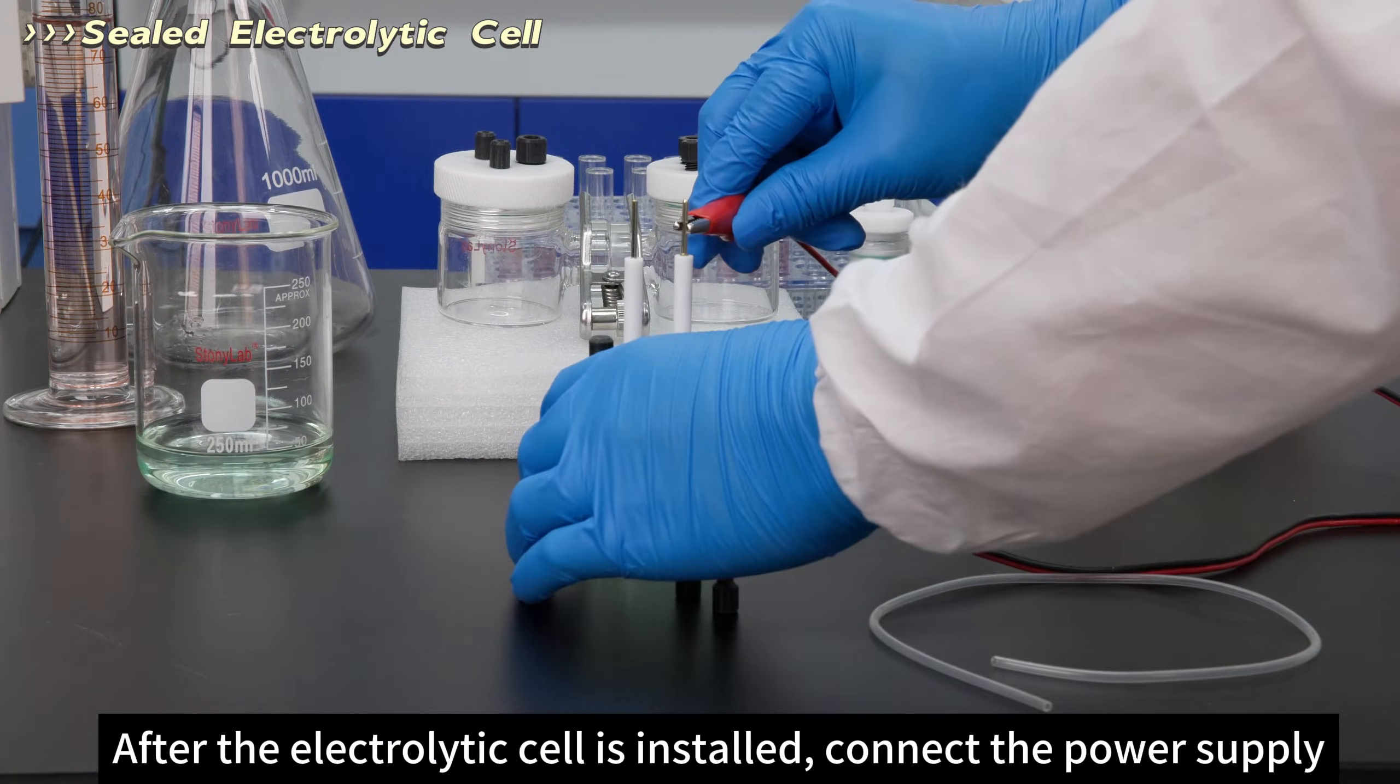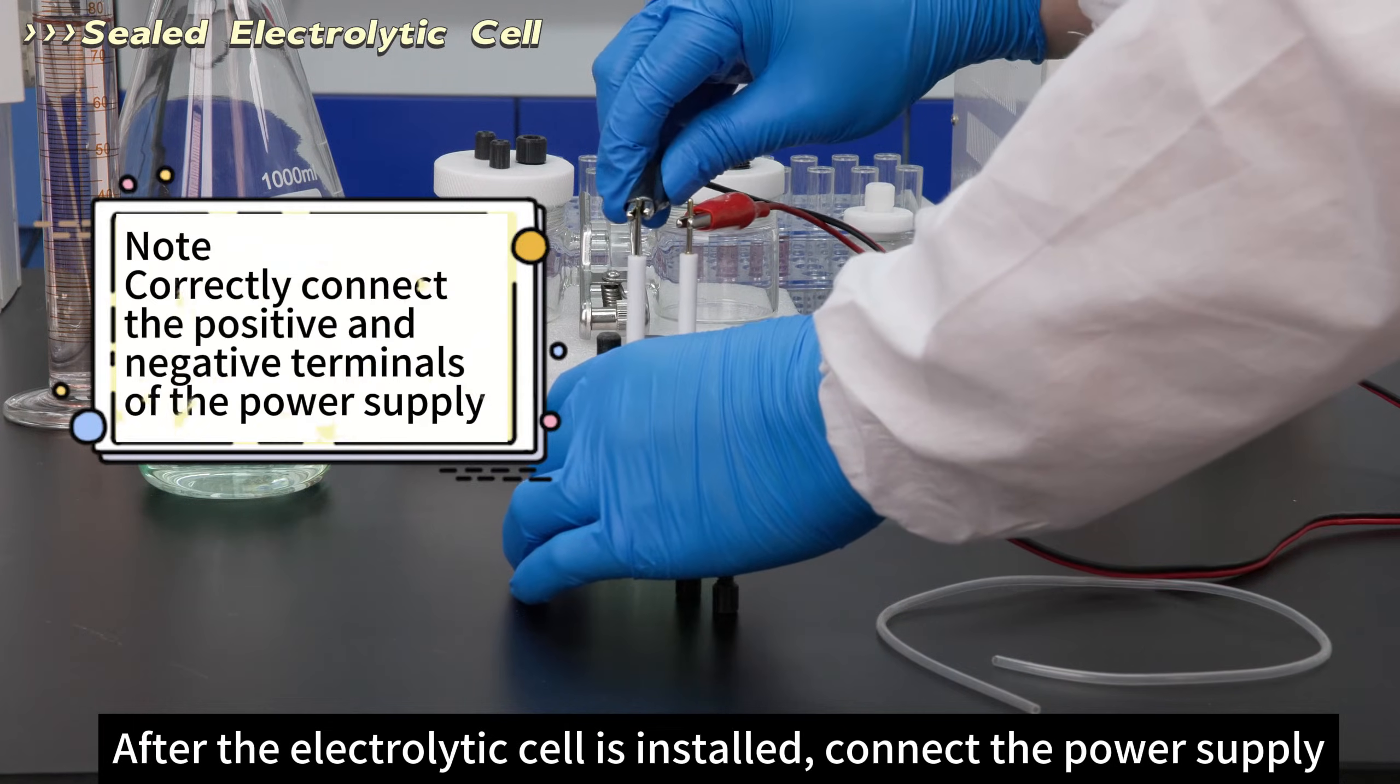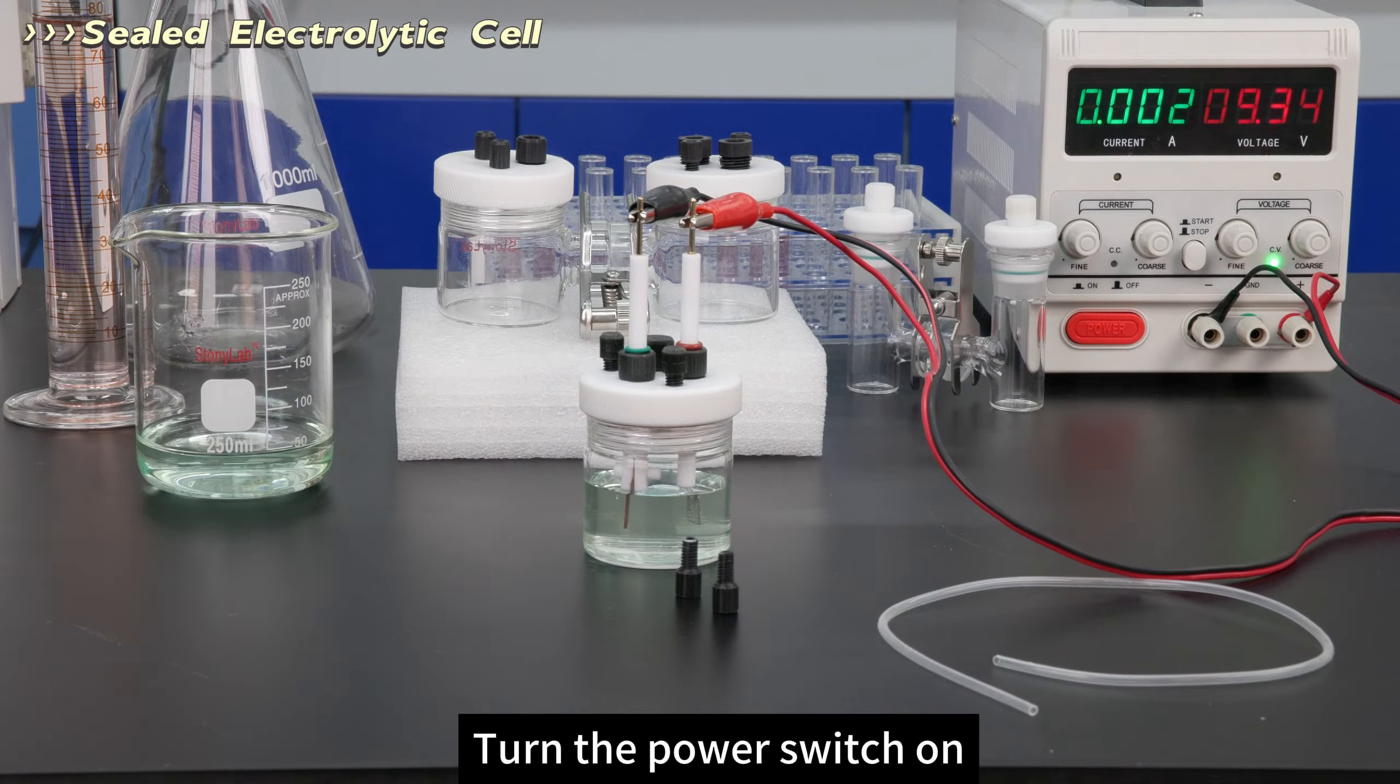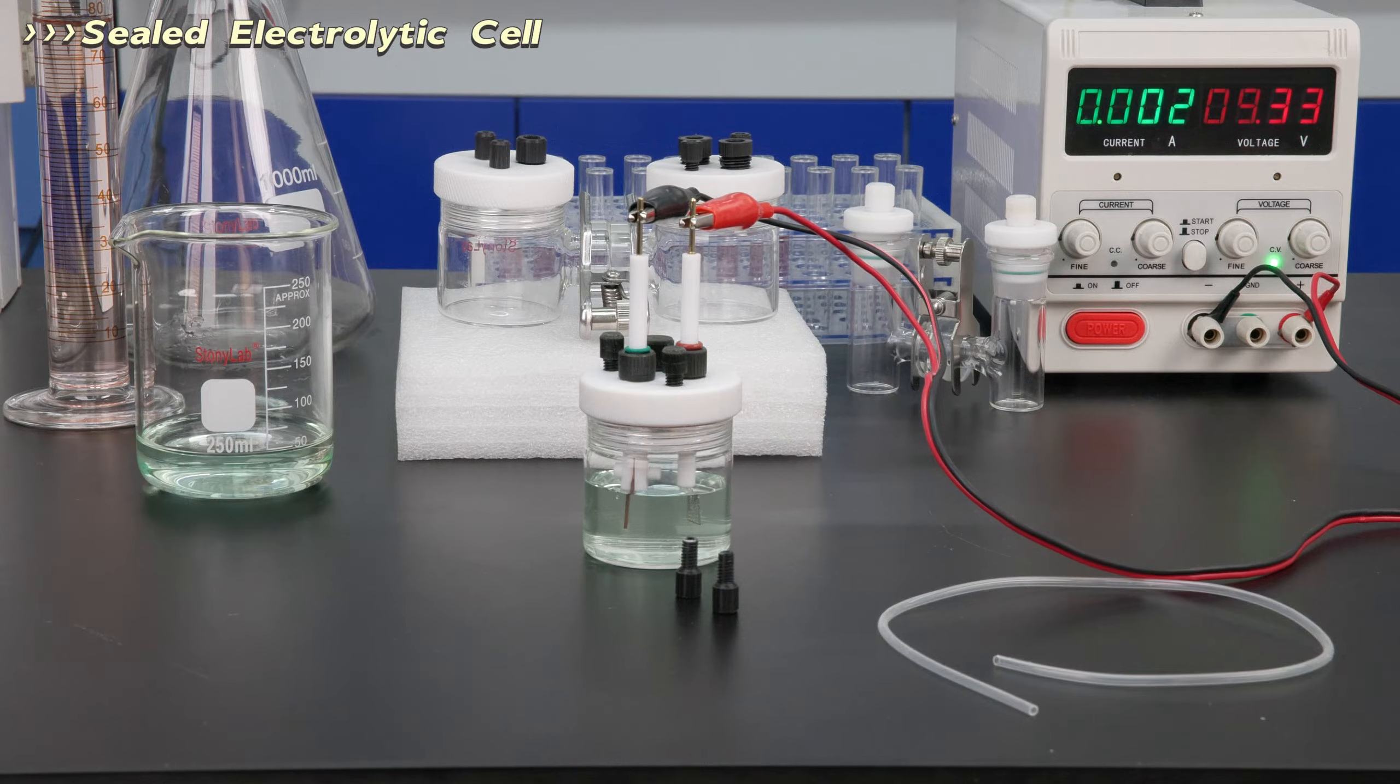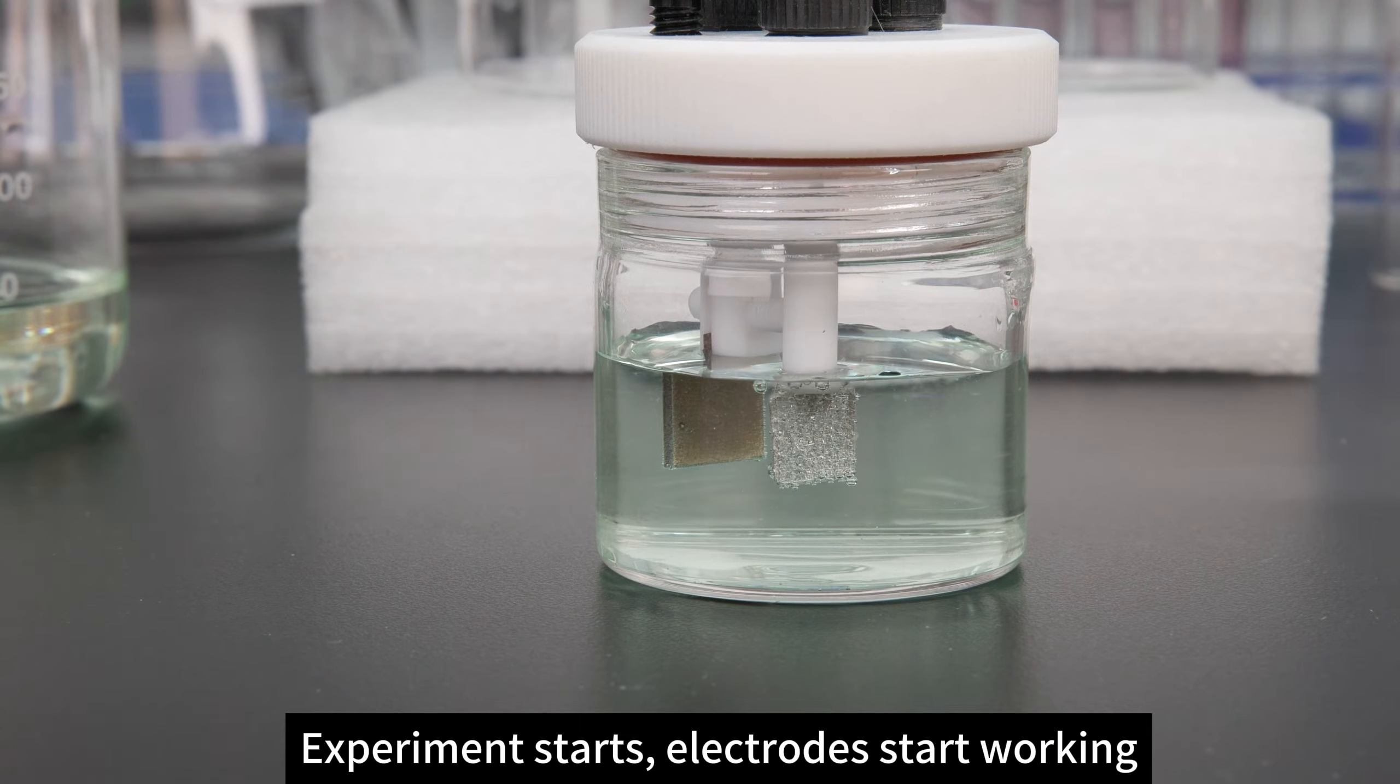After the electrolytic cell is installed, connect the power supply. Turn the power switch on. Experiment starts, electrodes start working.